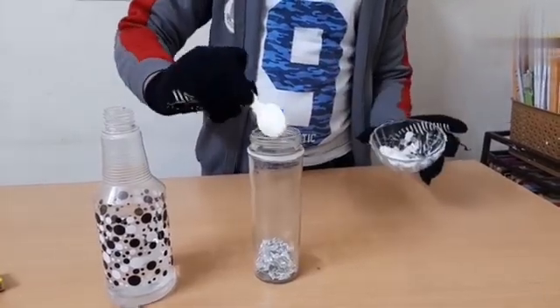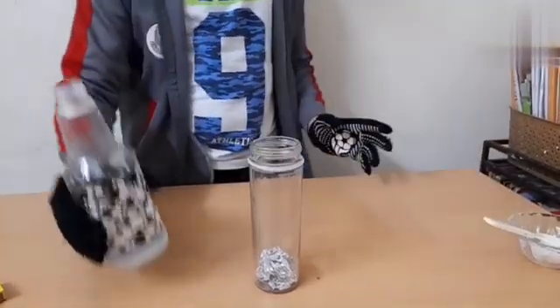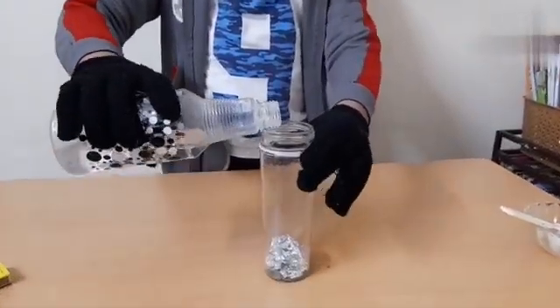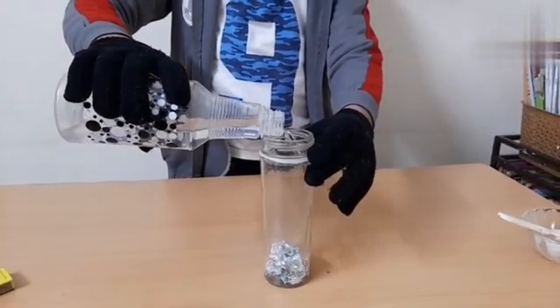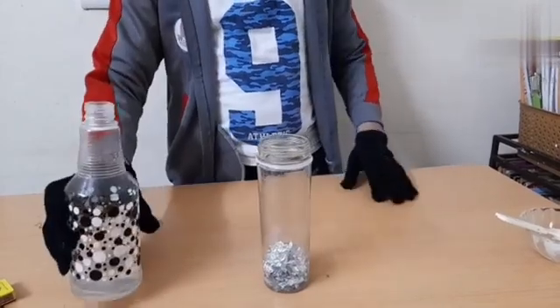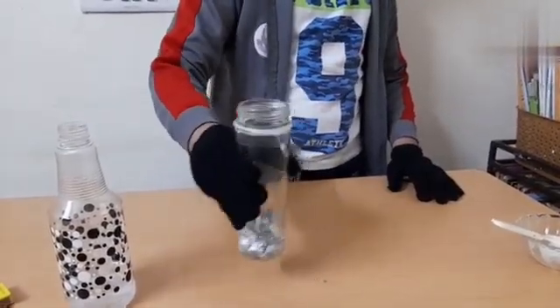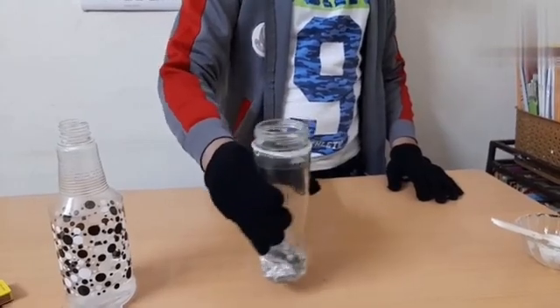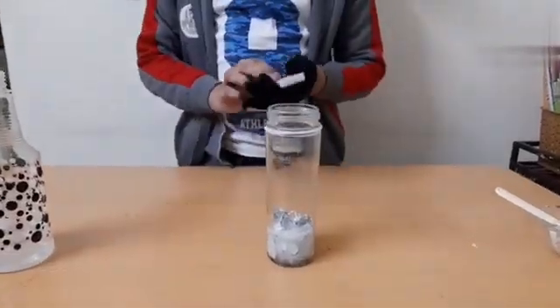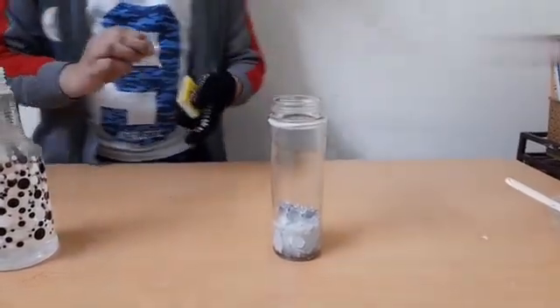I have put some caustic soda in it. Now I am going to put some water in it. Now I am going to shake it. I am shaking it, and you can see some gas is also being produced.